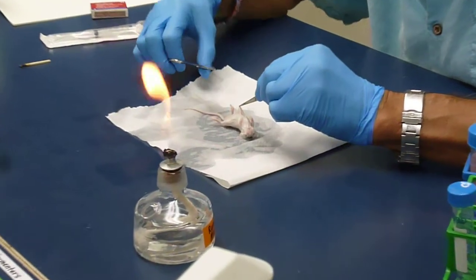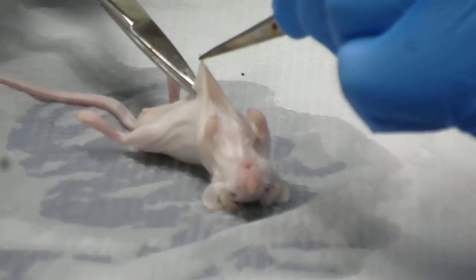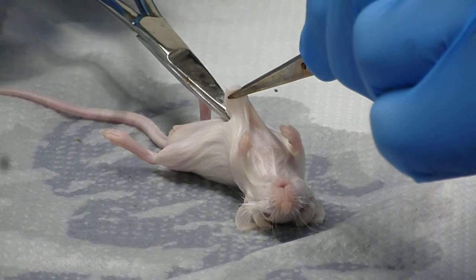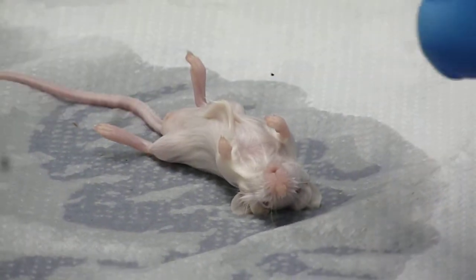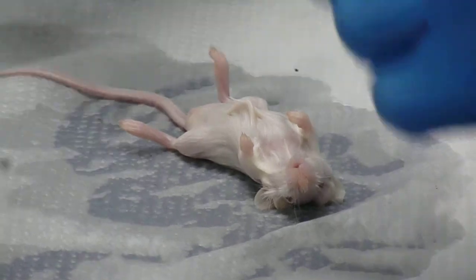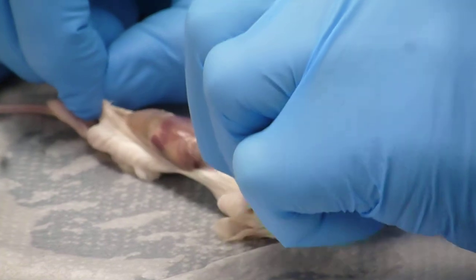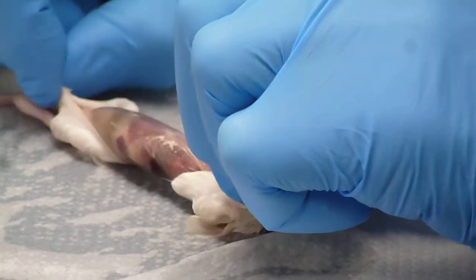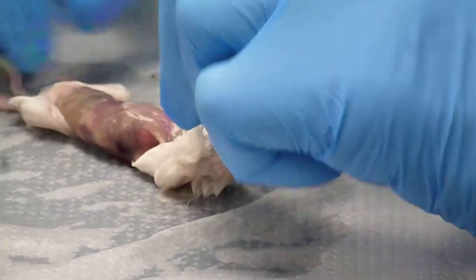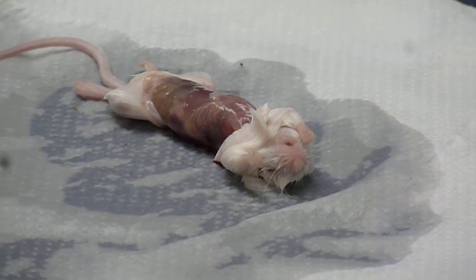I'm going to come in here and make just a little snip through the skin. I don't really want to get down into the chest or into the peritoneal cavity. Once I've done that, you want to peel the mouse out so you can see everything. Now you can see how transparent it is — you can see all the intestines and everything.